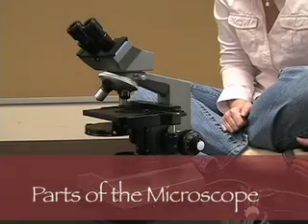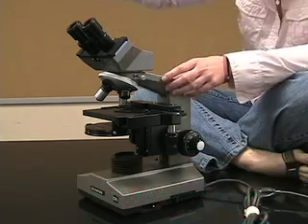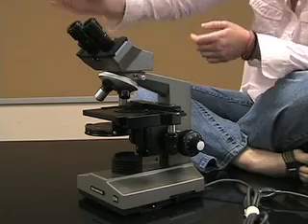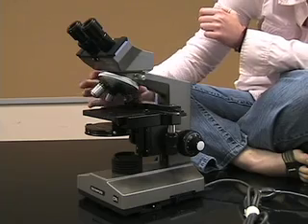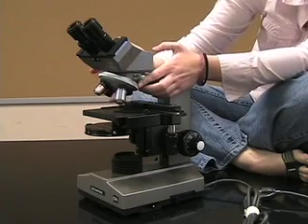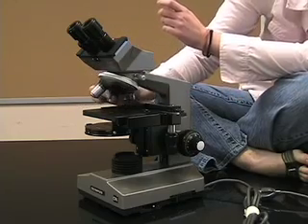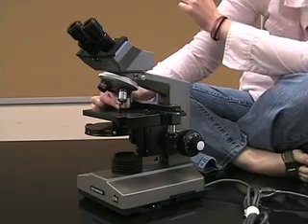Now we're going to go through the different parts of the microscope. Starting at the top, these two are the ocular lenses. Moving down, you have the revolving nose piece which contains three different objective lenses: the 4x, which is your smallest, the 10x, and the 40x.